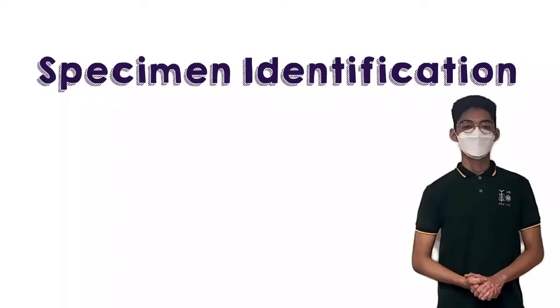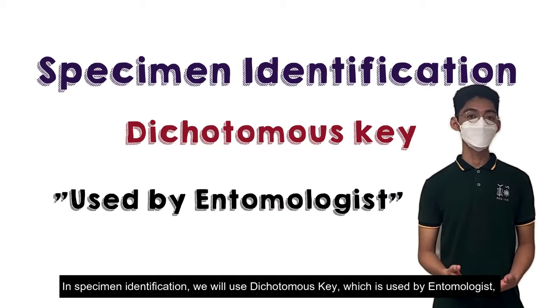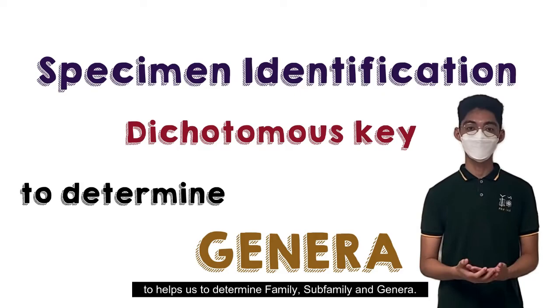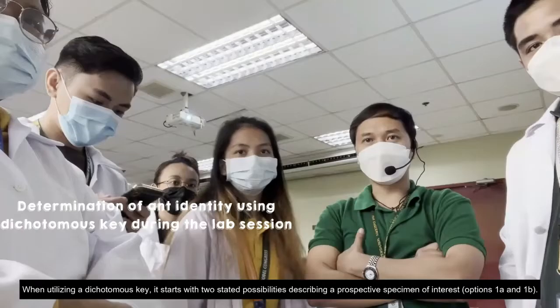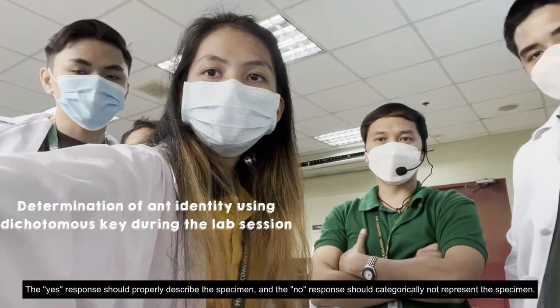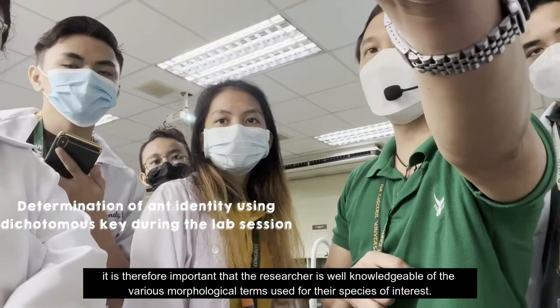In specimen identification, we will use a dichotomous key, which is used by entomologists — experts in studying insects — and is composed of different morphological statements and characteristics that help determine the family, subfamily, and genera. When utilizing a dichotomous key, it starts with two stated possibilities, options 1A and 1B, describing a prospective specimen of interest. We choose one of the available alternatives: the 'yes' response should properly describe the specimen, and the 'no' response should categorically not represent the specimen. Since the dichotomous key utilizes species morphology for identification, it is important that the researcher is well knowledgeable of the various morphological terms used for their species of interest.